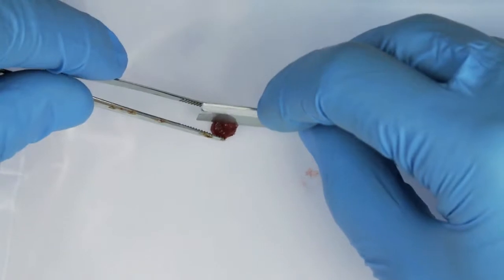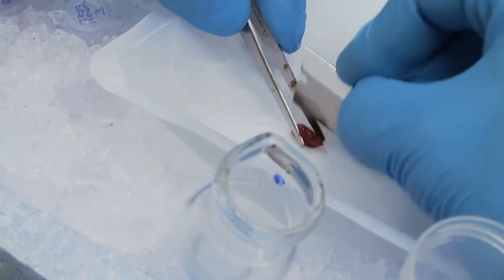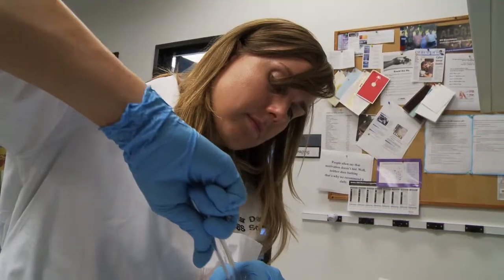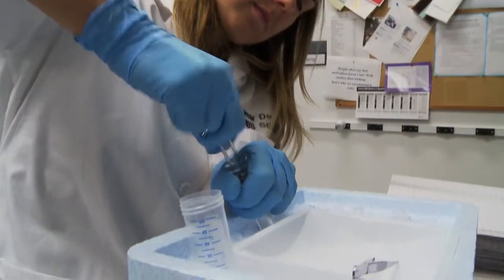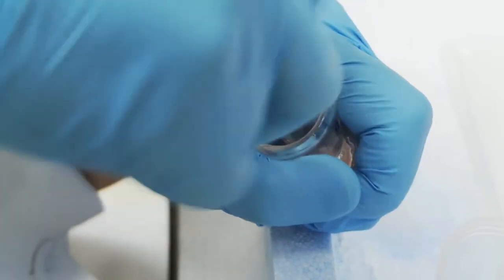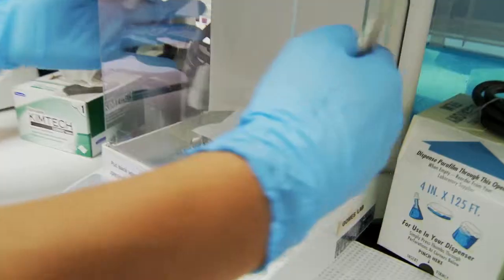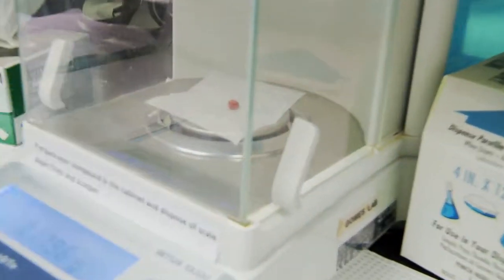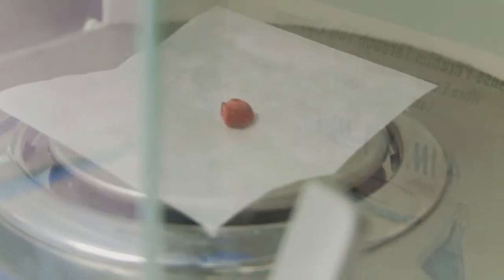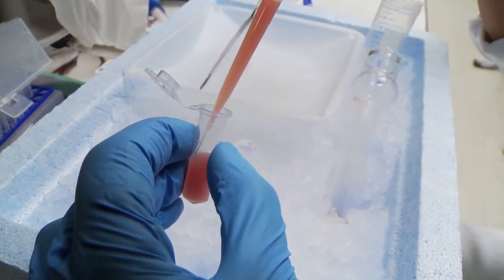I have to equalize the amount of protein across all my samples, and to do that we always double check our protein concentrations by running SDS-PAGE gels and staining them or imaging them. We also have to look at protein amount — so I have like 100 milligrams of tissue, and I'll end up with maybe 1.5 mils of 2.5 microgram per microliter concentration.